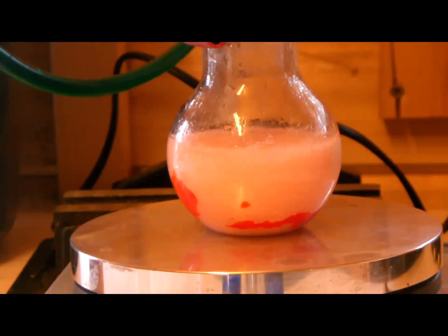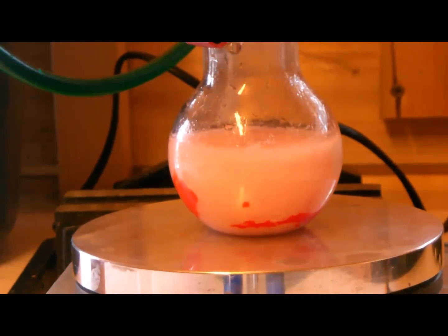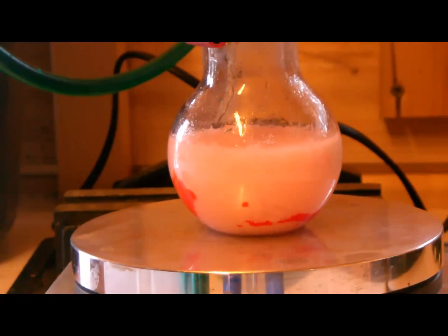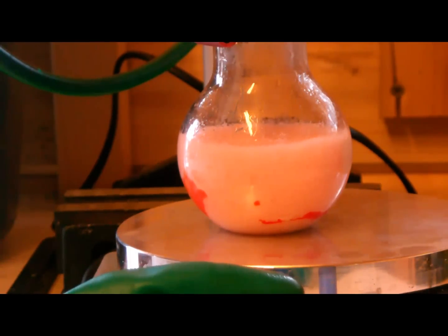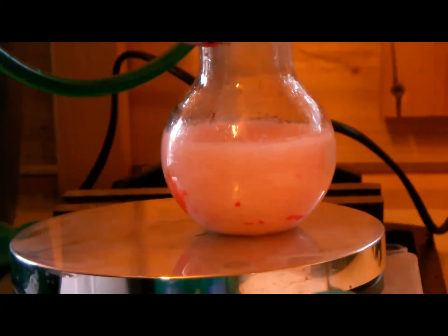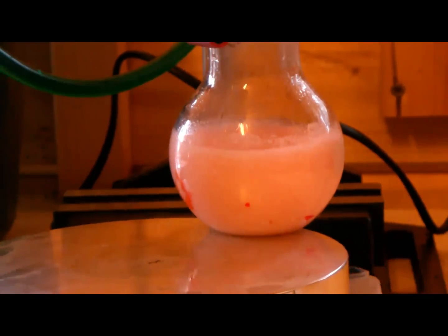Now you have to vacuum-filtrate your suspension. The residue in the filter paper is your phenolphthalein. Since it's crude, you have to wash it with some water to dissolve remaining phenol and phthalic anhydride. If you want highly pure phenolphthalein you have to recrystallize it in ethanol, but this should be pure enough for titration and indicator purposes.